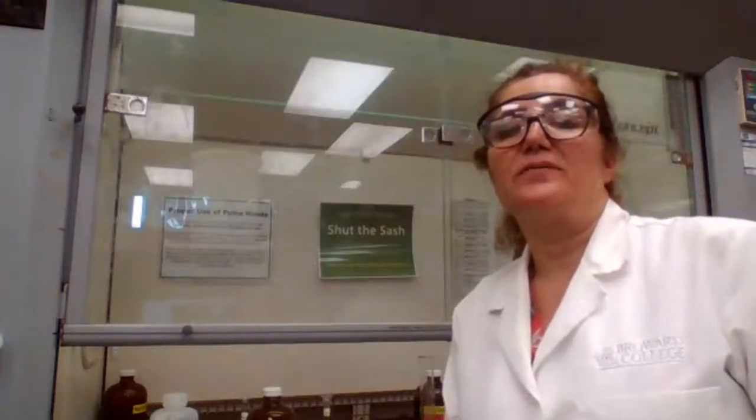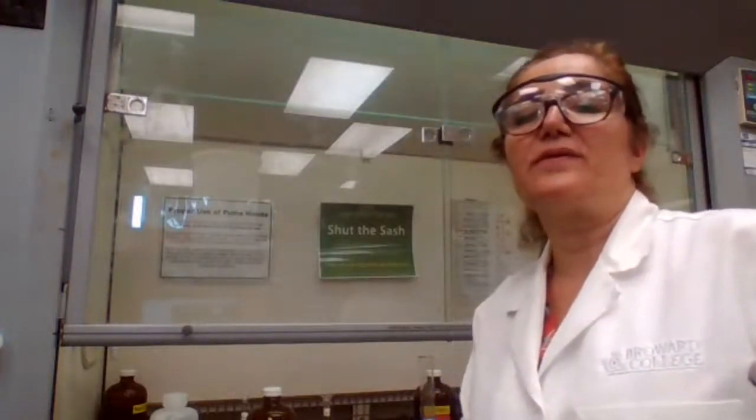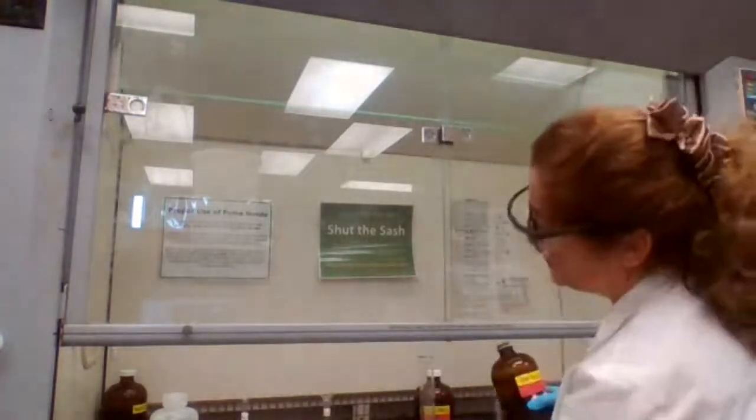Okay, what should I write now? Okay, 20 milliliters of, it's not the 0.6 actually, it's a 6 molar. 6 molar, 20 milliliters.